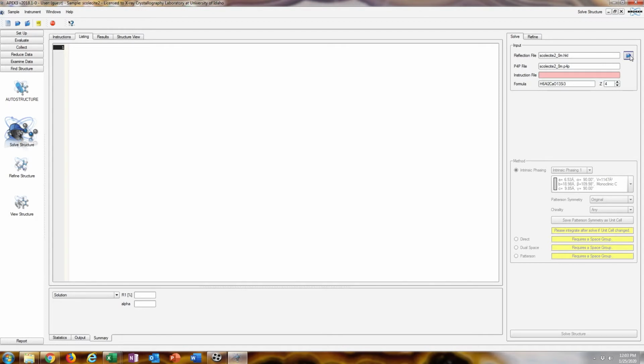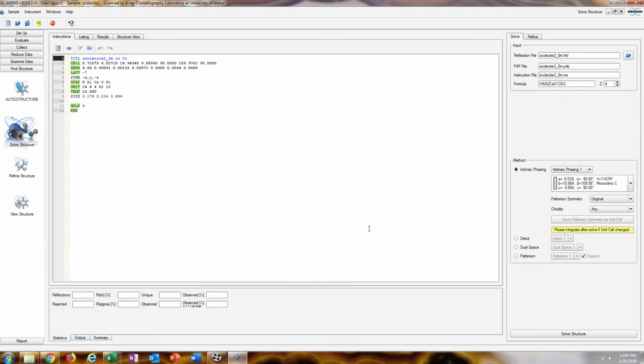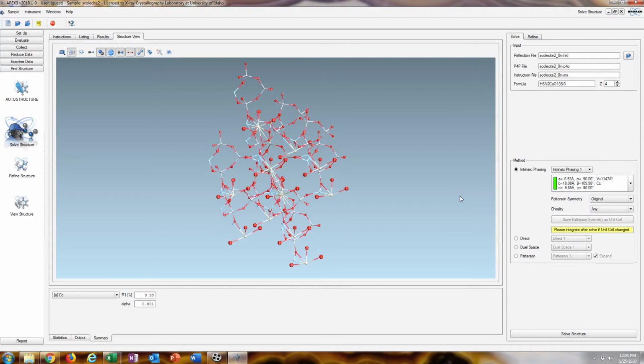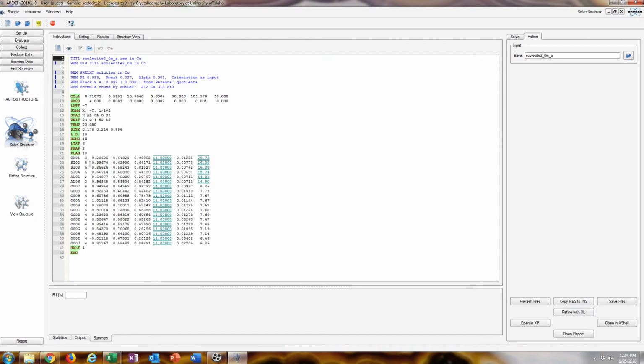I'm just going to reopen the HKL file, looking at the date modified on this to make sure that it is the one that I just did. Open that up. This is the correct lattice that I want to use. I'm going to click solve. And it solved pretty well in Cc already to begin with. 3.3% for the R1. That's very good, especially for a zeolite at room temperature. So I'm just going to click refine, copy res to ins.